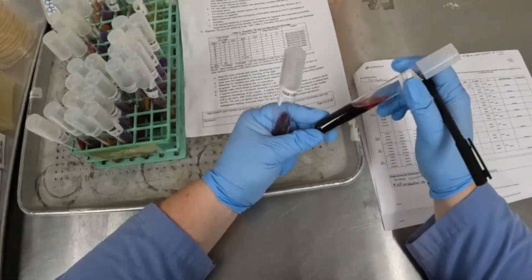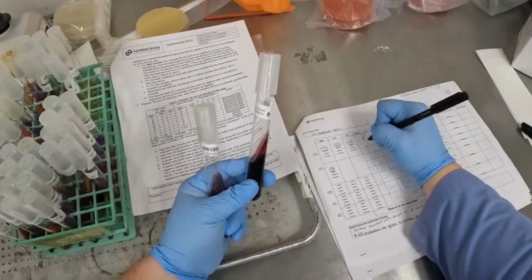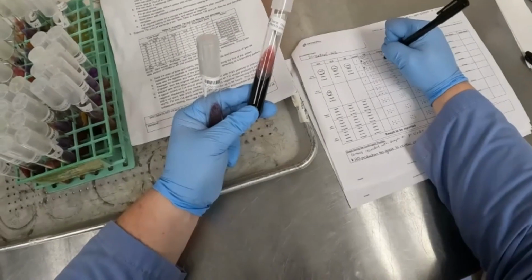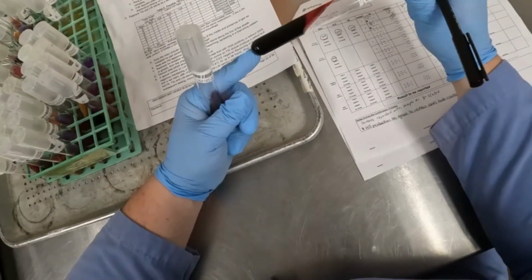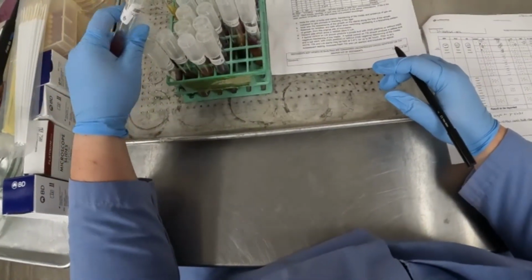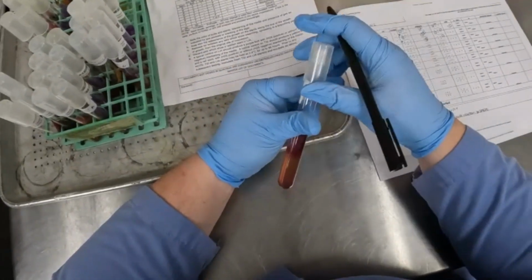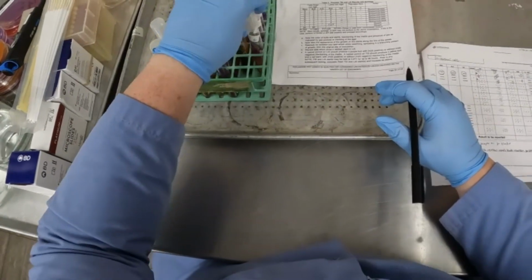All right, looking at isolate B, same thing here, really unable to tell the butt's reaction. So we're going to do red. I'm just going to put the same little asterisk to notate that the H2S production is too strong. So it does have H2S production. I don't really see any gas production. You should still be able to see those air pockets if there were any. So I'm going to circle N for no. And then same set of reactions here. We have a purple slant over a yellow butt with no H2S production.